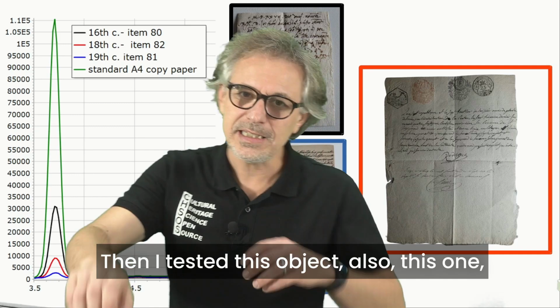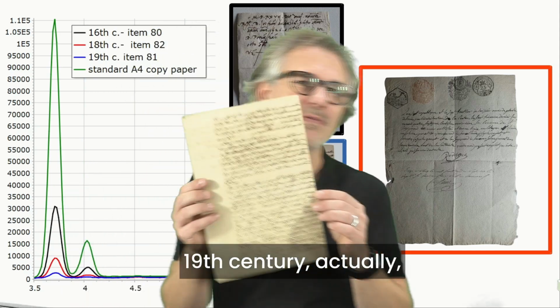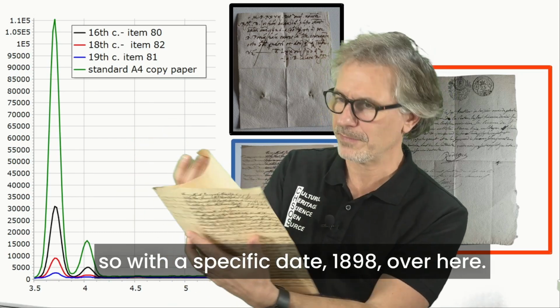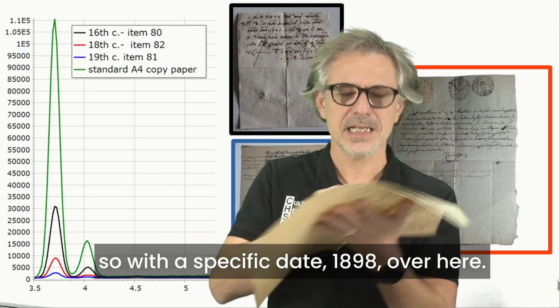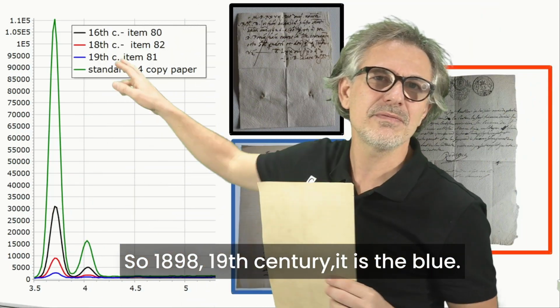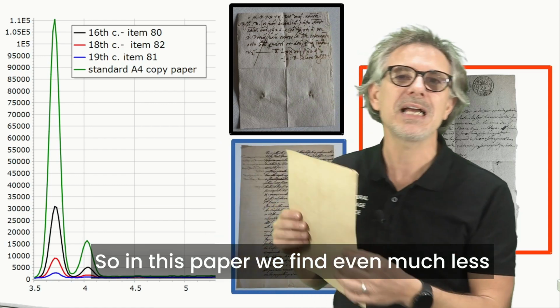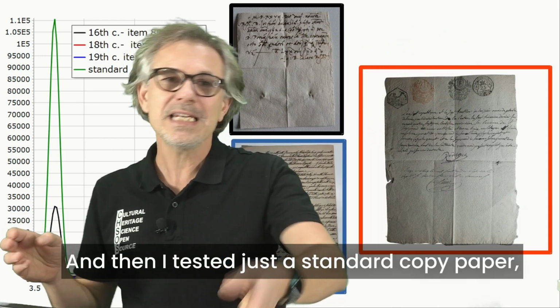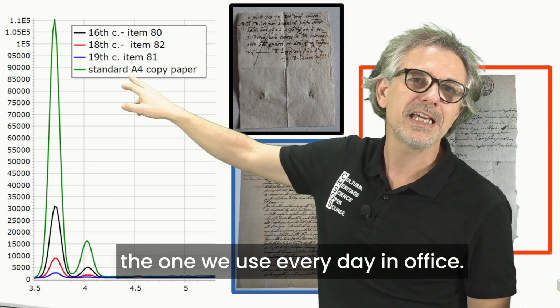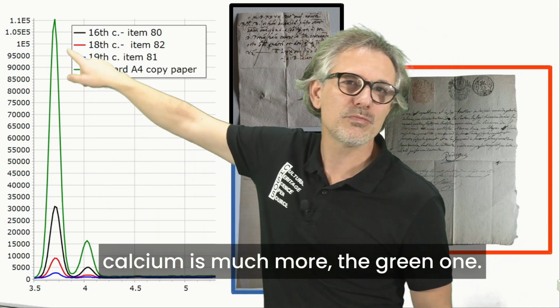Then I tested this object also, from the 19th century. Actually there is the date because it's a notary document, with a specific date, 1898. So 1898, 19th century, is the blue. In this paper we find even much less calcium. And then I tested just a standard copy paper, the one we use every day in the office, and in this case the amount of calcium is much more, the green one.